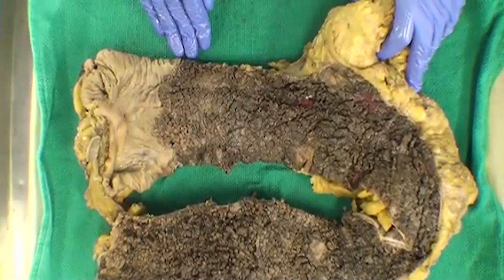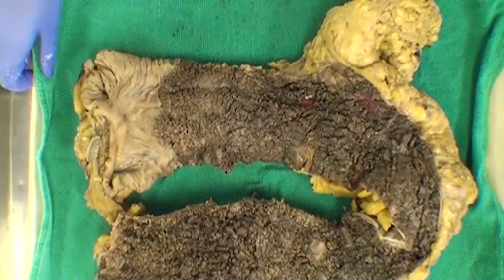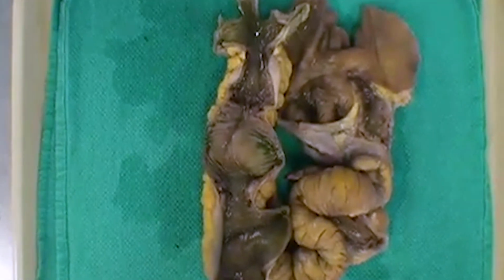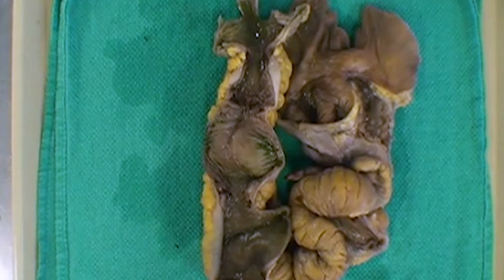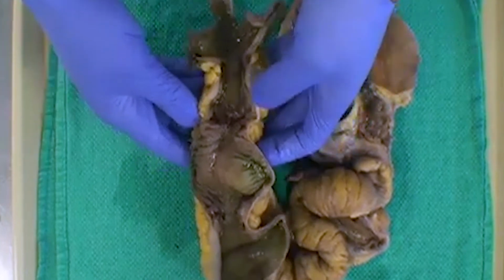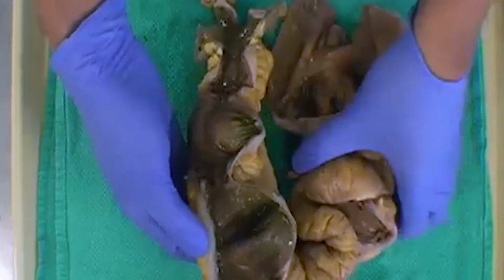And so with that wrapped up, we'll then put up our second specimen, which will be a nice contrast, I think. Okay, perfect. So just like with our first specimen, as you see it, I'll demonstrate, and maybe people can just comment or shout out what they think, first of all, this specimen is or what surgery has been done here.